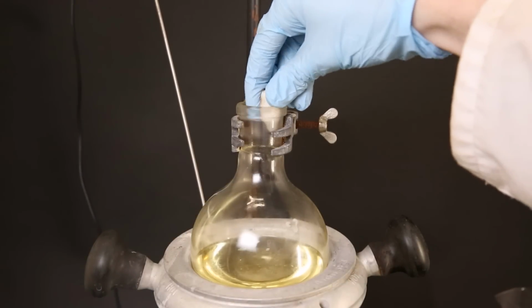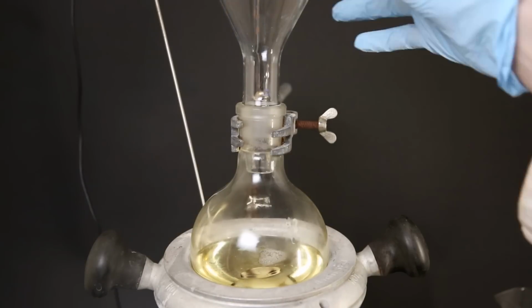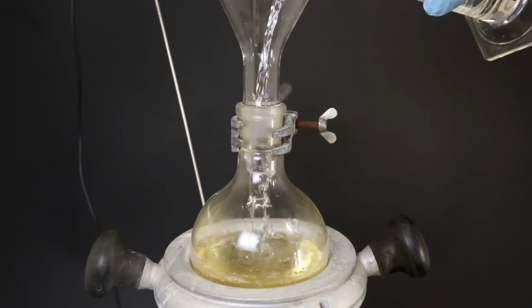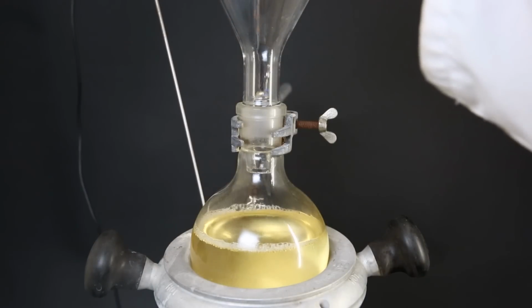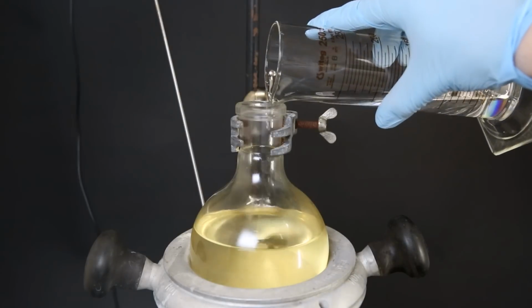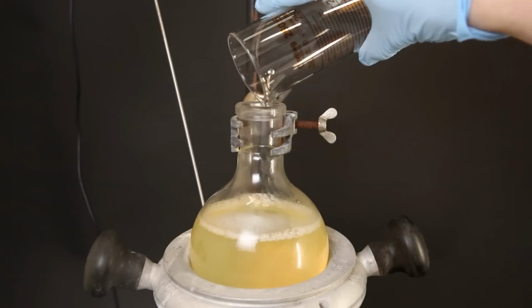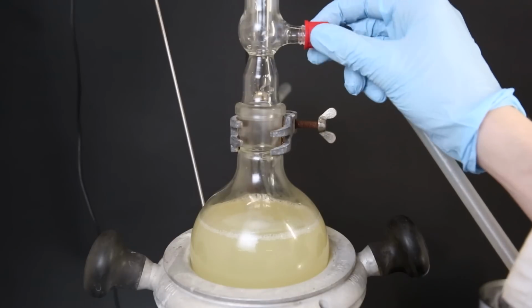Before I attach the condenser, I drop in a stir bar and add 150 ml of cyclohexanone to the flask. Then I add 48 ml of methyl iodide and attach the condenser and bring it to a boil.